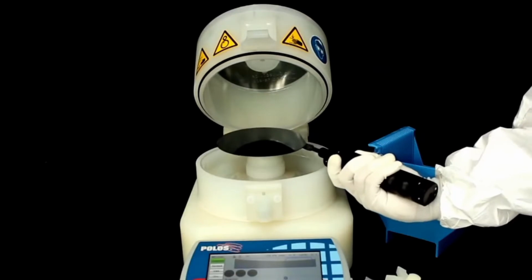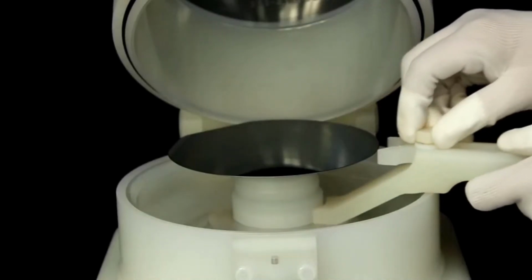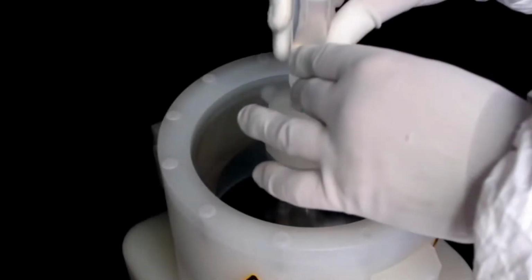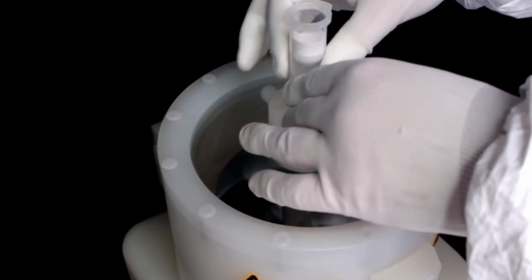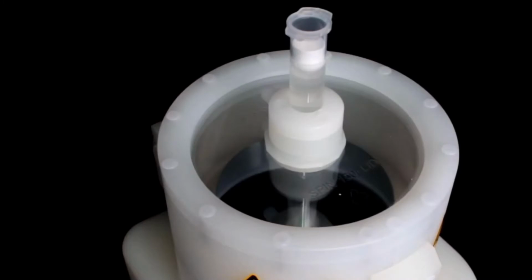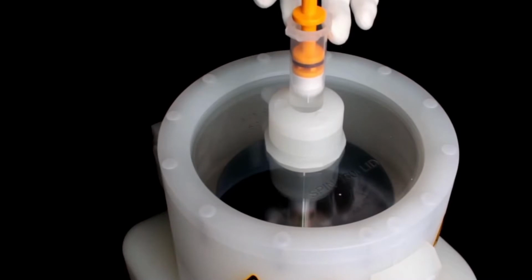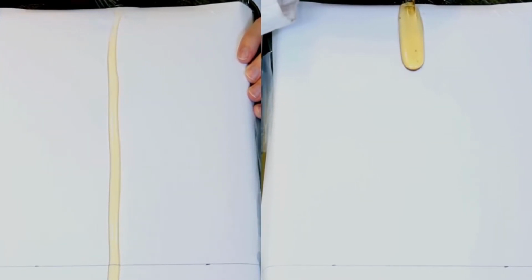Spin coating is a technique used to deposit uniform thin films onto a substrate by means of high-speed rotation. The process begins by applying a small amount of the coating media to the center of the substrate. The substrate is then spun quickly, allowing centrifugal force to disperse the coating media to coat the substrate evenly, where any excess is simply ejected off the edge of the substrate. Rotating the substrate at a higher speed and/or for a longer period of time can produce a thinner film. Additionally, many properties such as the coating viscosity can be manipulated to affect the final thickness of the thin film.